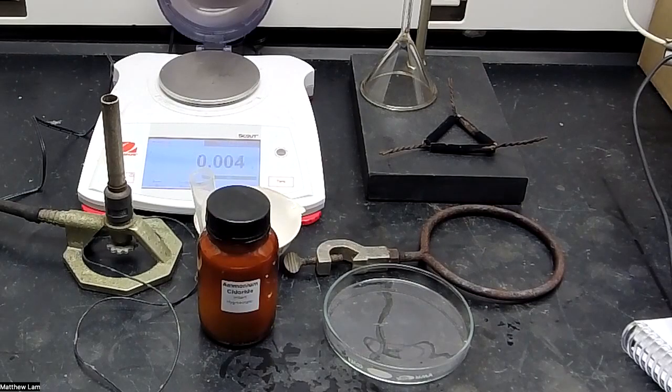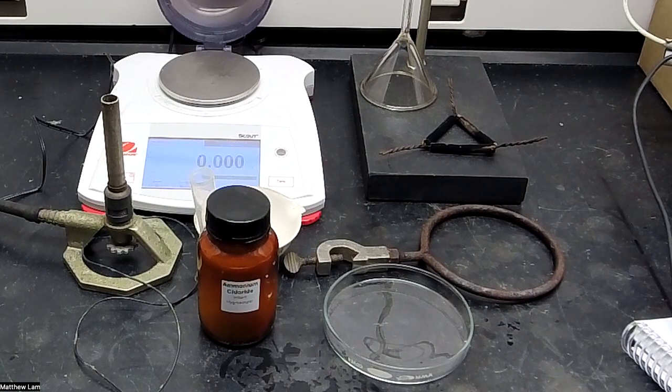Hello, Chem 161 students. Today, we're going to be doing the sublimation experiment.